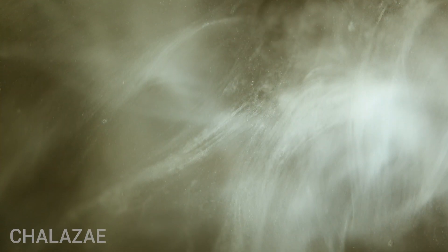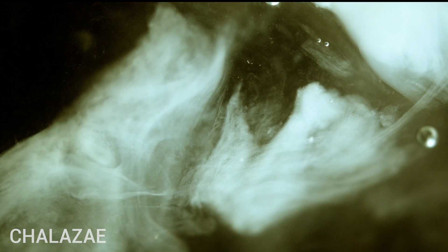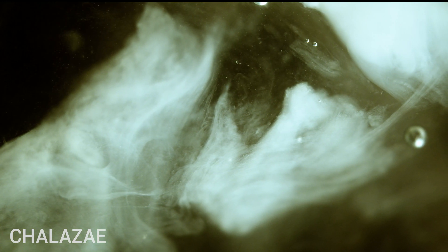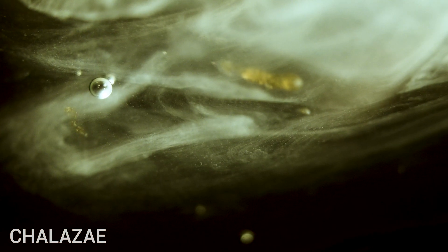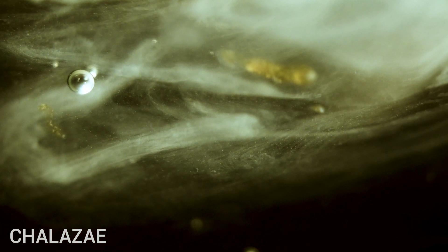So let's move to the second element, which is called the chalaza. In layman's terms, these are ropey strands of egg white which anchor the equatorial region of the yolk, at opposite ends of the yolk. Their job is to act as balancers, maintaining the yolk in a steady position in a laid egg. Apparently, the more prominent the chalaza, the fresher the egg — that's an interesting fact.